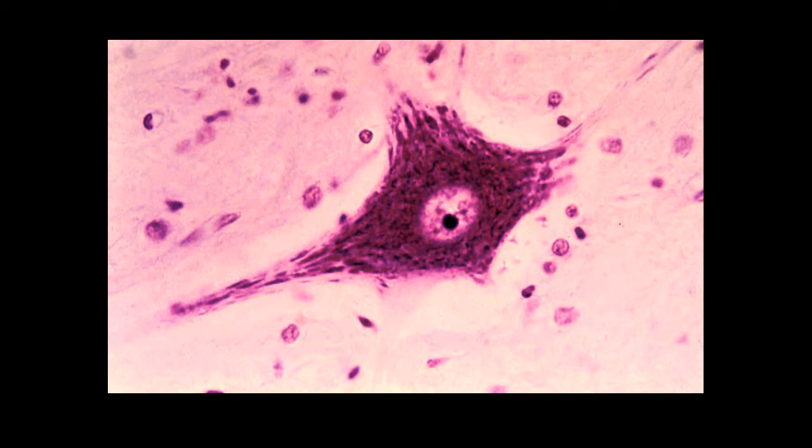The cytoplasmic Nissl substance, which is all this granular or punctate staining, essentially consists of rough endoplasmic reticulum and polyribosomes. This stains basophilic, and it occurs in clumps because what you're going to learn later in the course is that the substantial microtubule networks disrupt the continuous sheets of the rough endoplasmic reticulum, so that when a neuron cell body is stained, you see these clumps of material, and this is given the name Nissl substance.